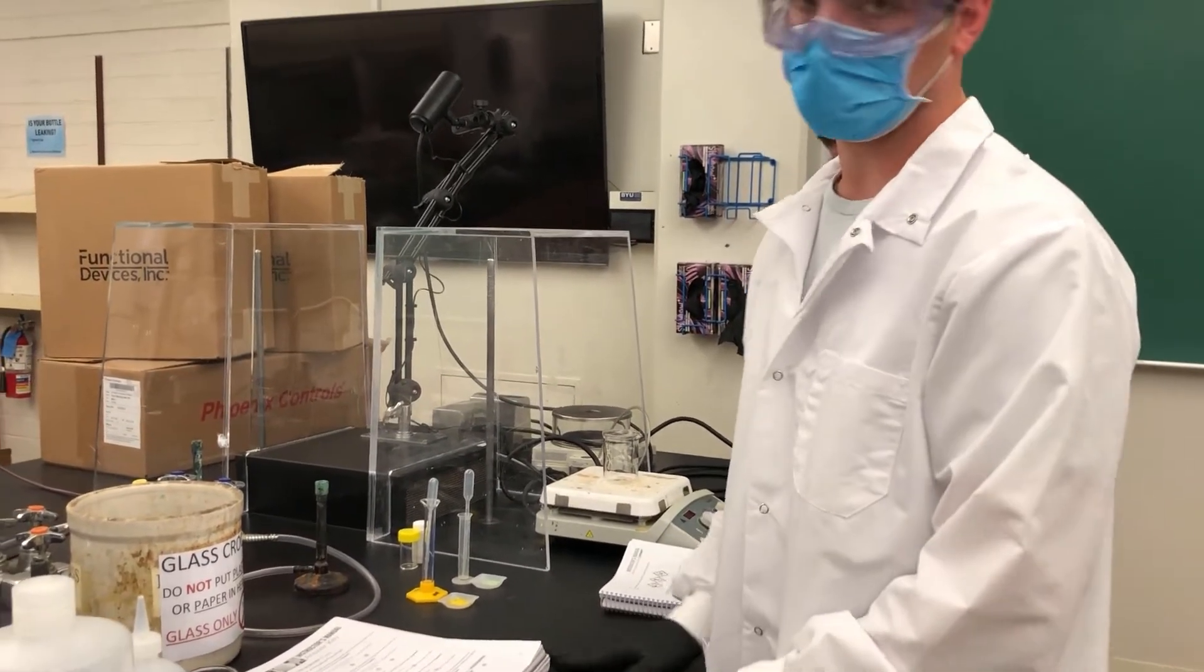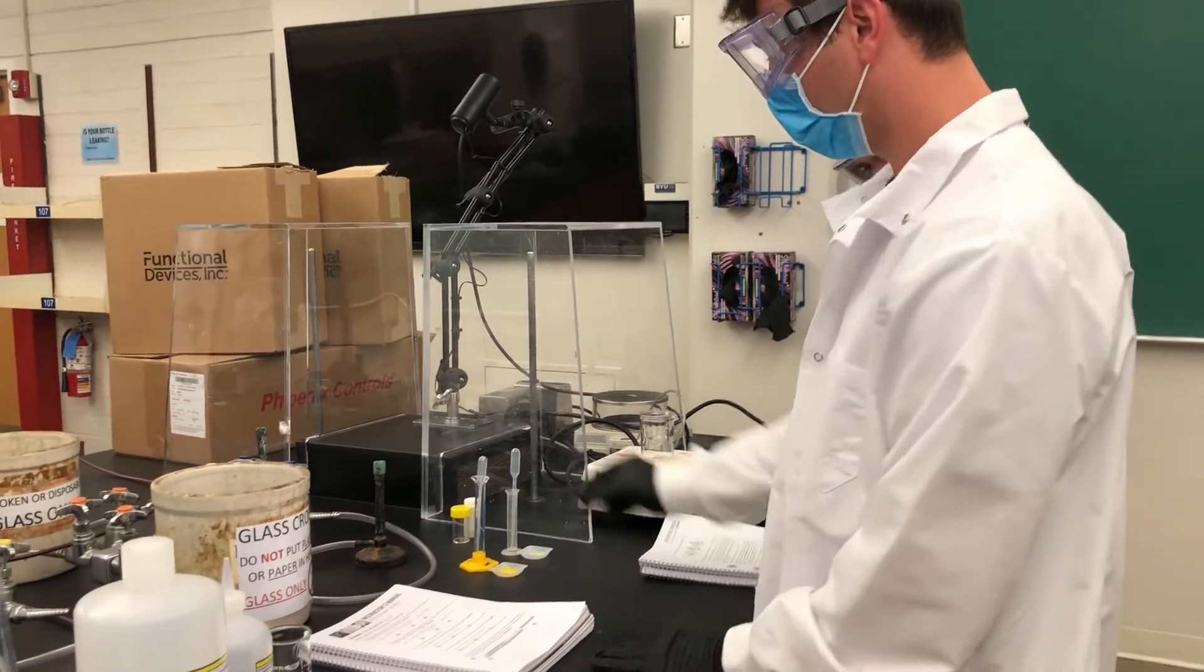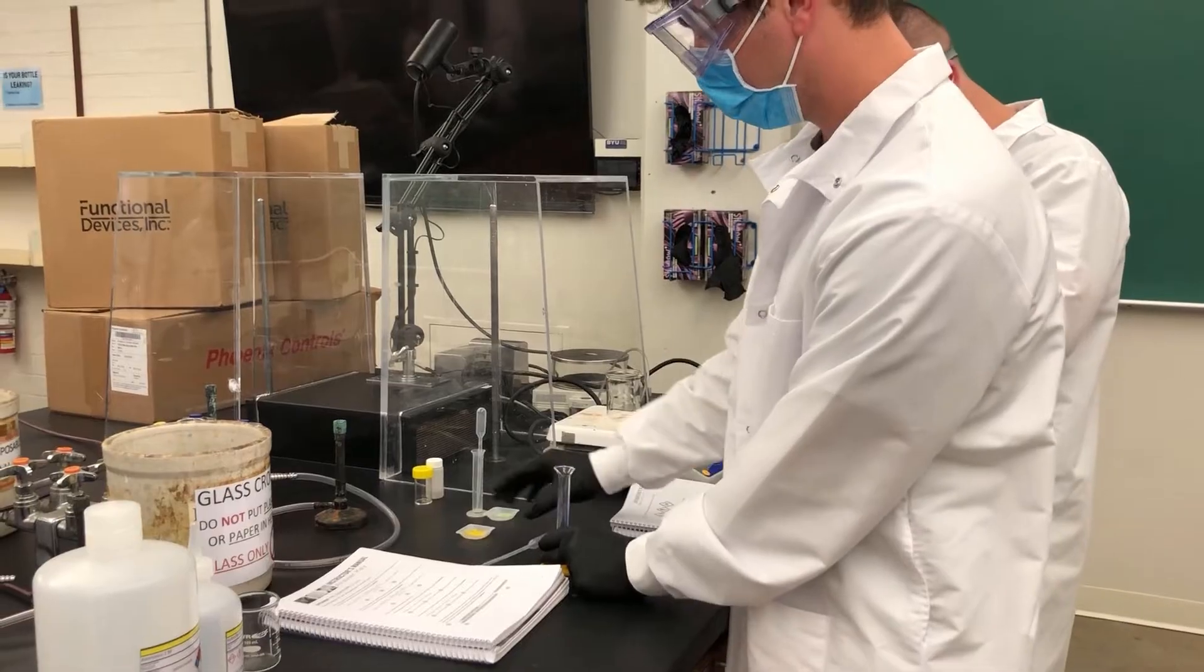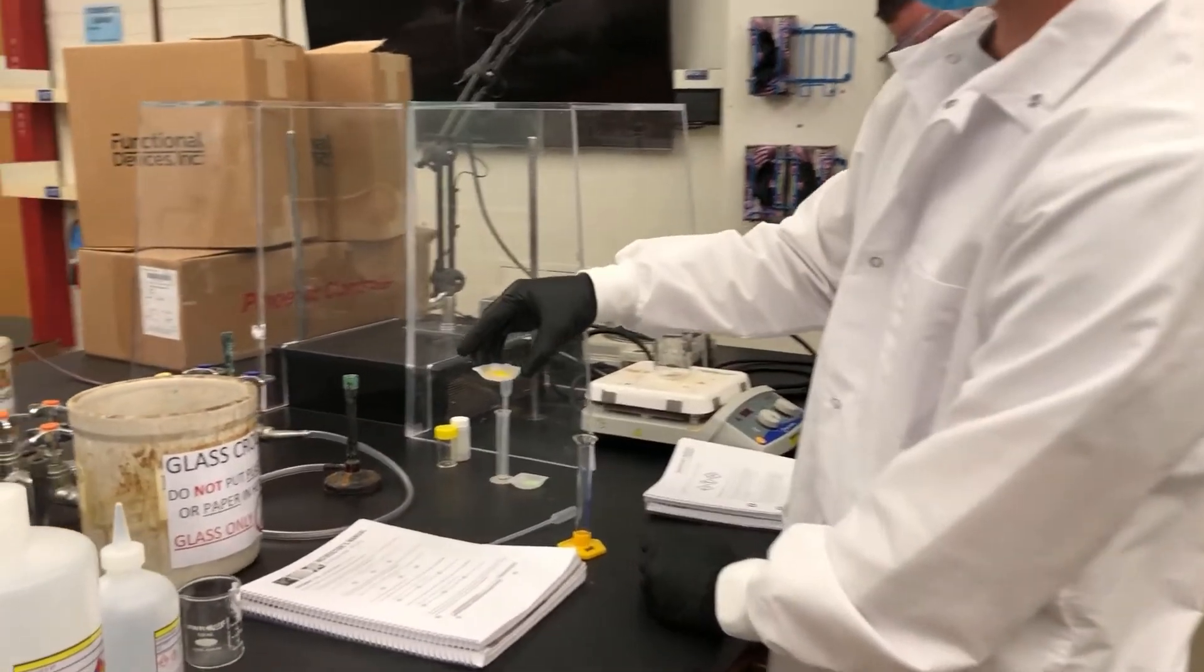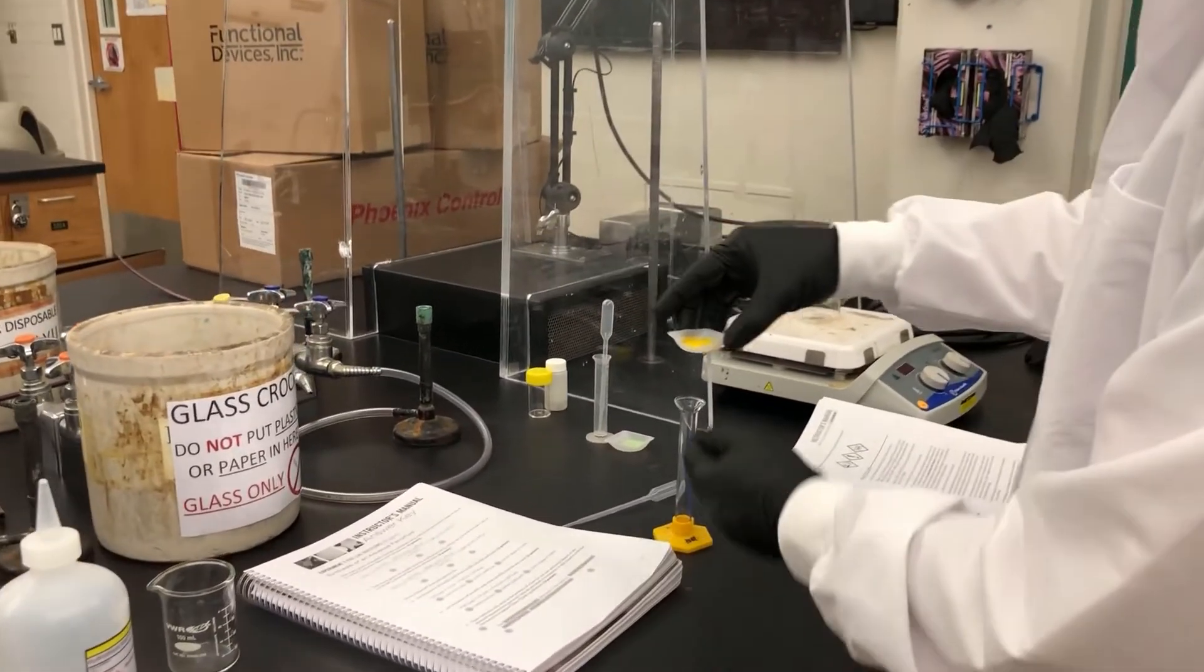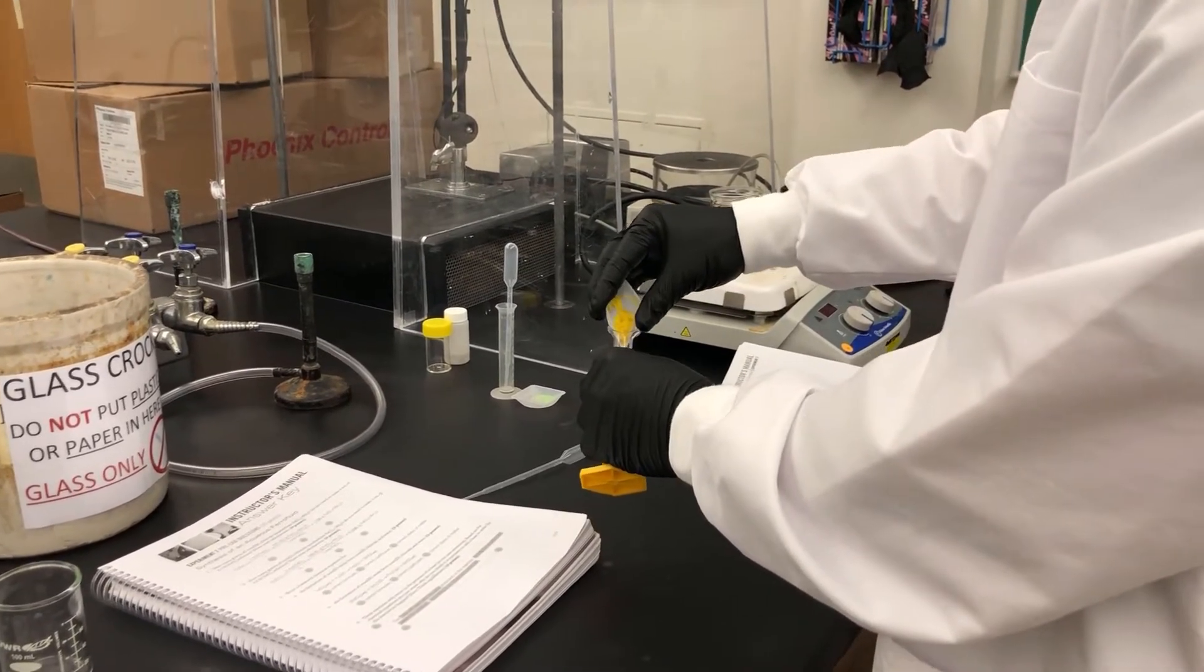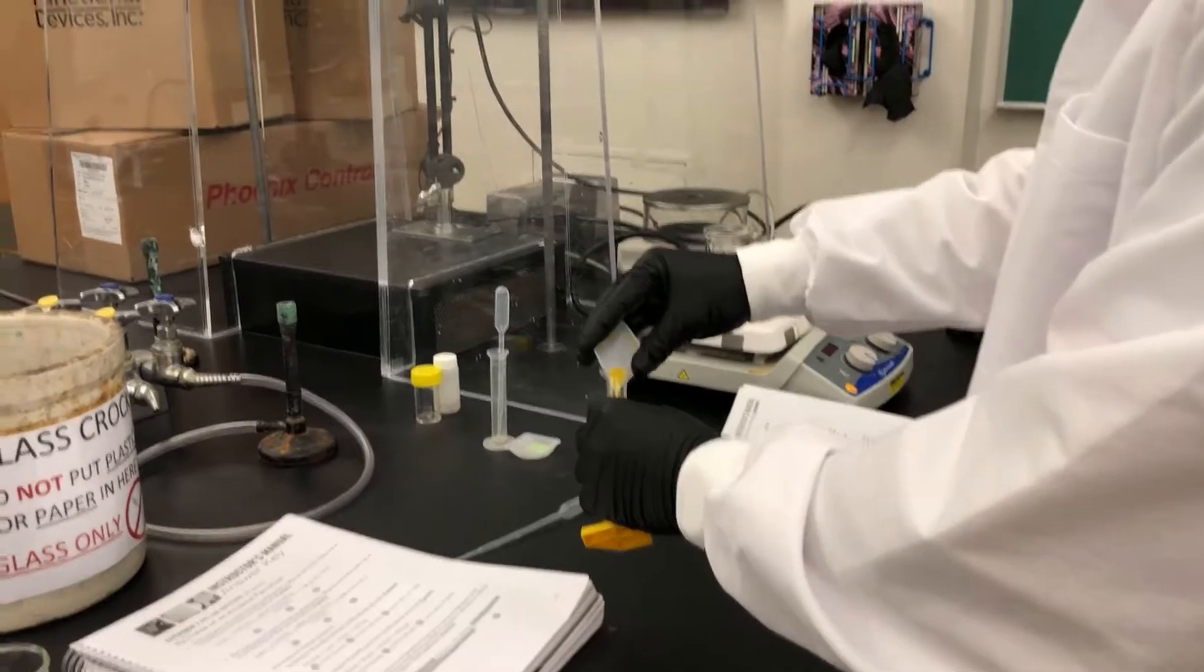Like it says in your book, we will need to make a 1 molar iron 3 chloride solution. So here I have measured out my 1.08 grams of iron 3 chloride hydrate. So I'm going to add this to my graduated cylinder.